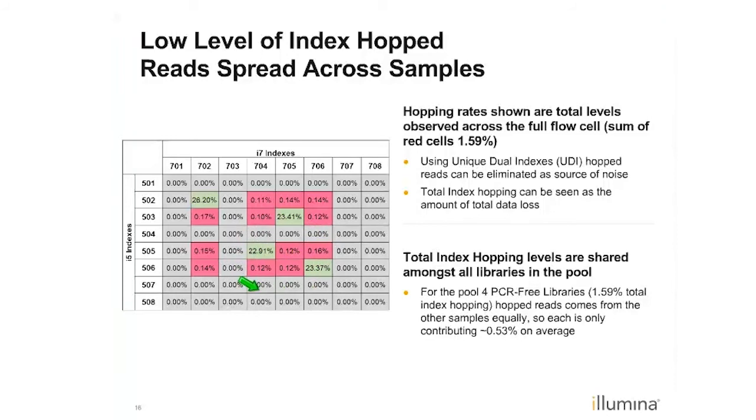And so in all the previous slides when we talk about index hopping, essentially what we're doing is running an experiment like this and then summing up all of these pink or red boxes, and that's what we call, in this case, 1.6%. You can see that the actual measured amount from any given library into another is actually much lower, but if you add up the rows and columns for any given library, you will get slightly higher levels depending on how you add them.